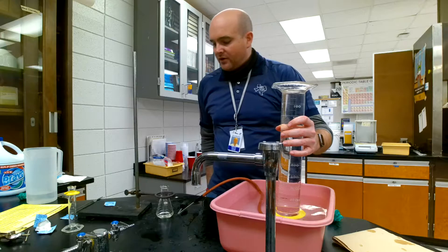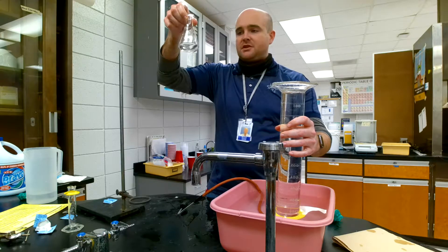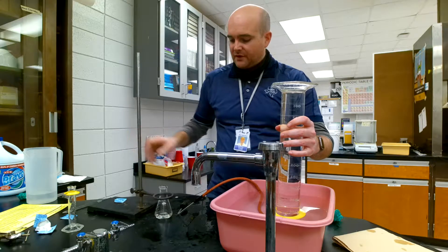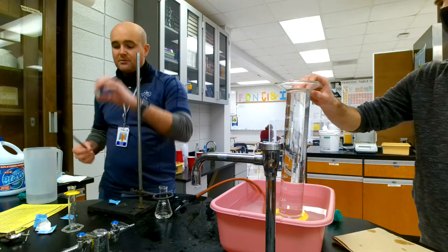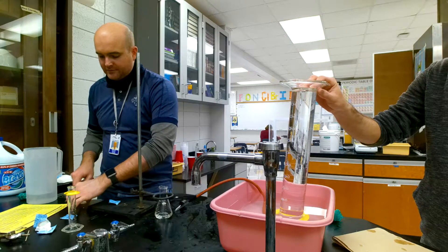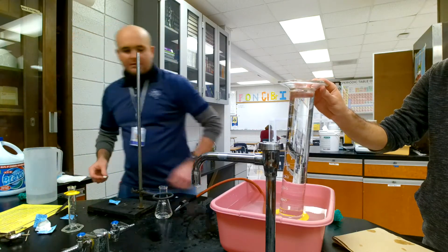And we have our flask of 30 milliliters of water. So this is just plain old room temperature water, and we're going to secure it with our ring stand so it doesn't fall over. And we're going to take this Alka-Seltzer tablet. We're going to score it with a file so we get exactly half of it, because we're going to save that other half for the next half of the experiment. I'm going to put that over there just so it doesn't get wet.